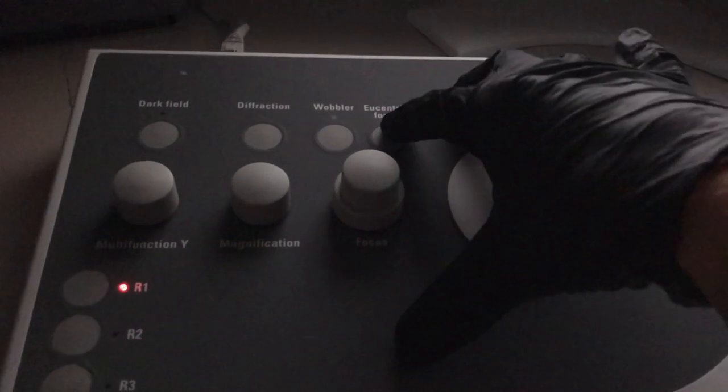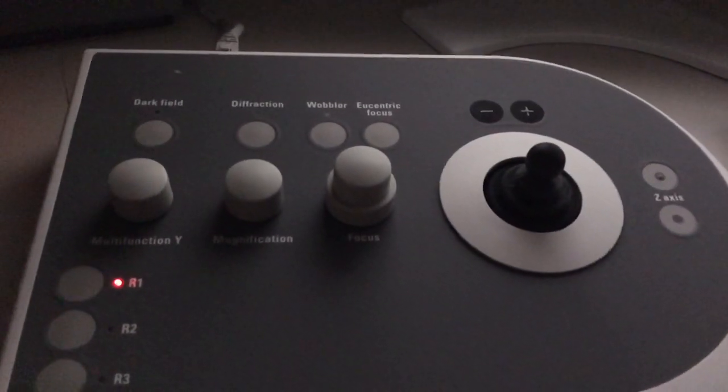One thing you have to be cognizant of whenever you do a lot of tilting of the specimen is that in doing so, you usually end up deviating slightly from eucentric height. So since we did some tilting of the sample to set up the two-beam condition, I'm going to now re-establish eucentric height. Just like in the previous demo, press eucentric focus. And again, we're going to adjust Z to minimize the contrast. We're not off by a whole lot.